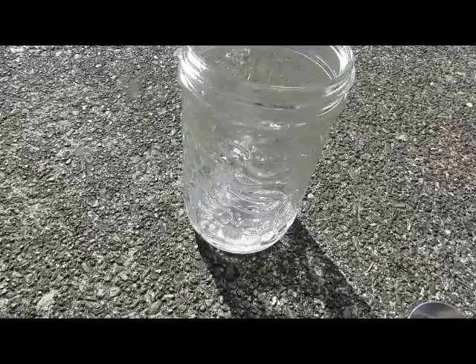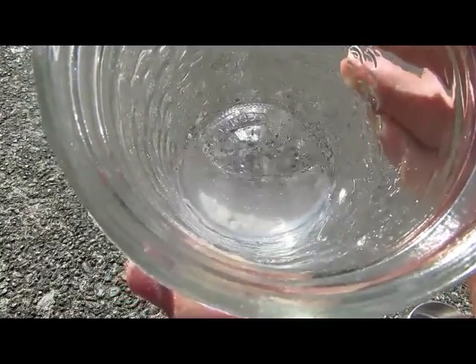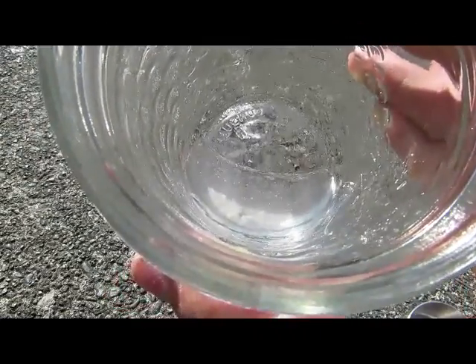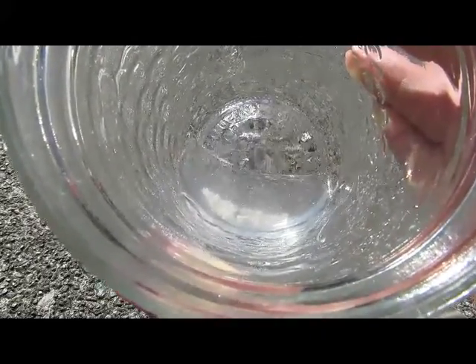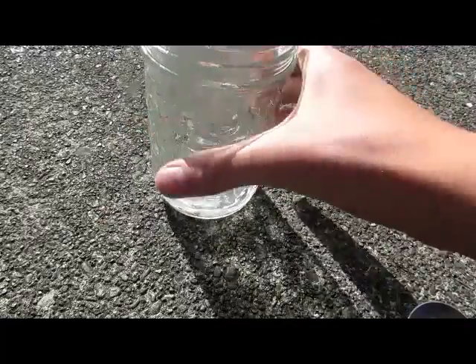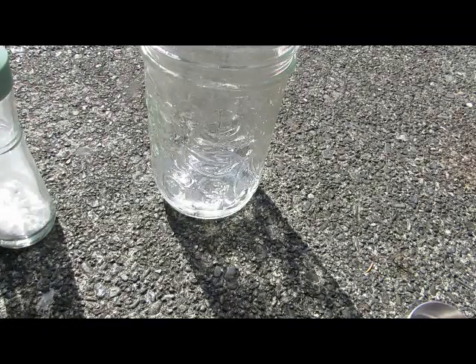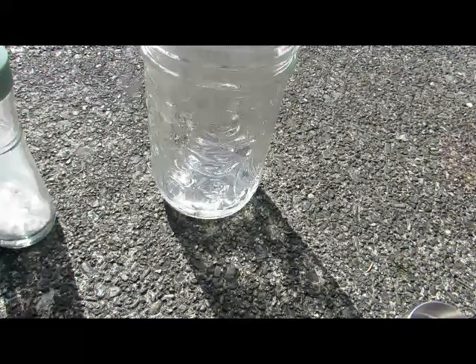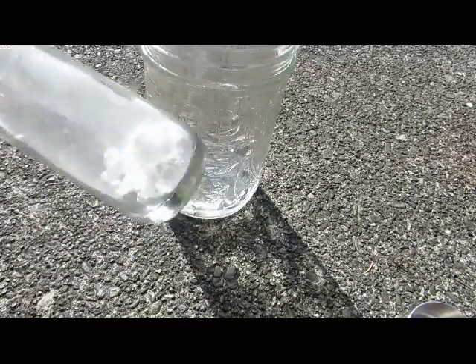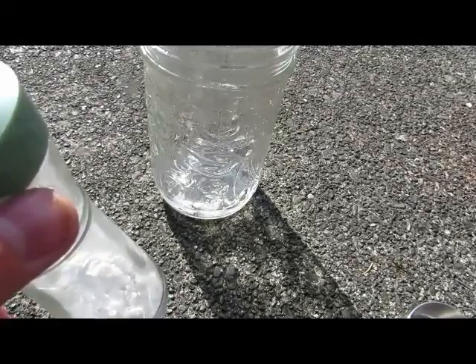Even the fine powder pieces are just in suspension. About five minutes later, we're still left with a fair amount at the bottom. Lithium carbonate is only slightly soluble in water, so a bit would dissolve, but you can tell it's a much greater difference than before — previously everything dissolved and released a bit of oxygen gas, whereas this stuff is just sitting there, mostly very insoluble. That's basically how to make lithium peroxide, which is very useful as it absorbs carbon dioxide and releases oxygen, similar to trees but through a chemical rather than biological process.